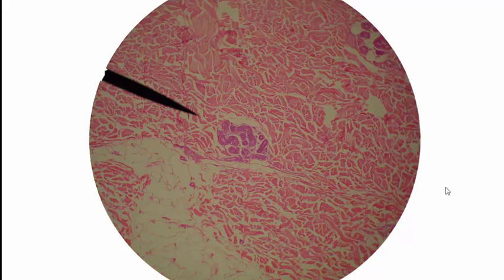This is, I believe, high magnification of thin skin, and there's a few things we could look at on here. First of all, the major layer that we see up here is the dermis, and we're seeing the beginning of the hypodermis down below here. It's adipose tissue, and that lets us know that we're in the hypodermis. And this structure is a sweat gland, an eccrine sweat gland, and over here we also have an eccrine sweat gland.